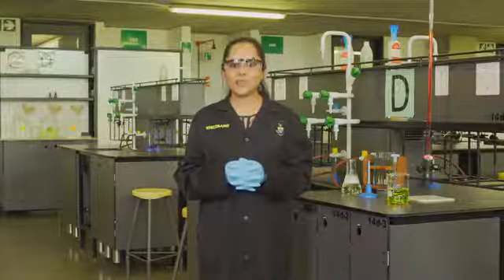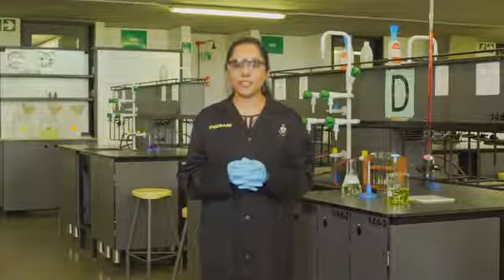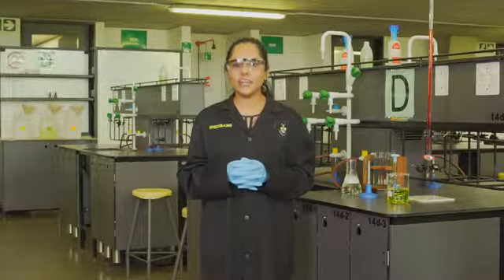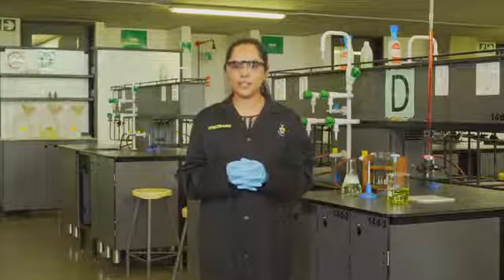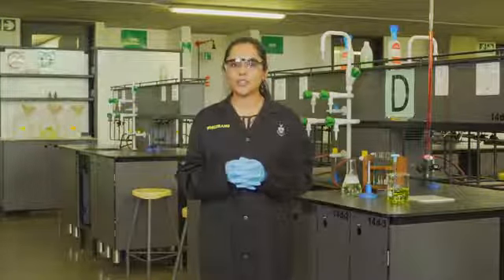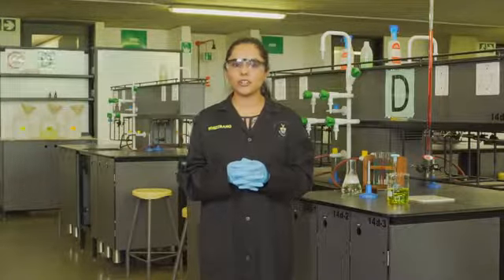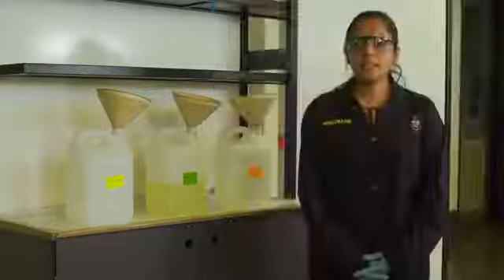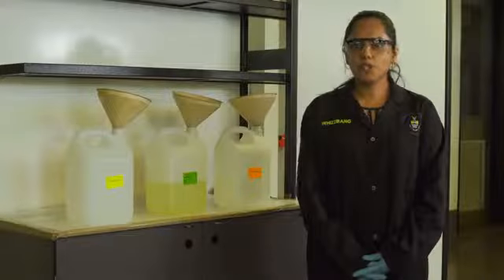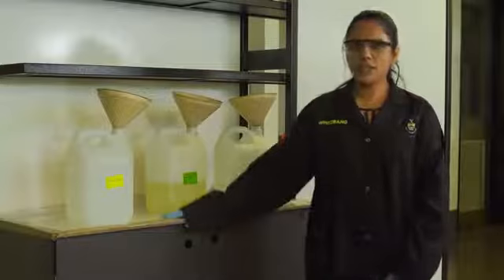Any hazardous waste should not be poured down the sink. If there are any chemicals left over after the experiment, these should not be taken back into the stock container to prevent the risk of contamination. There will be a designated waste station in the lab for hazardous waste collection.